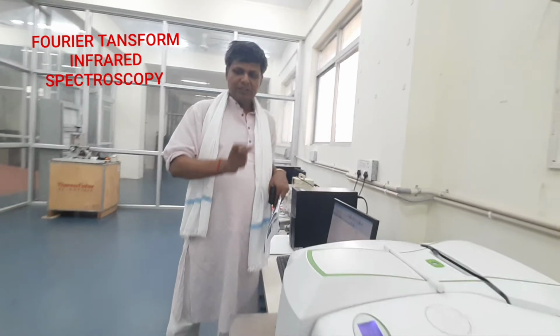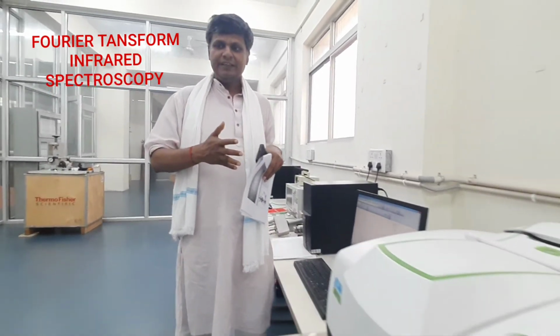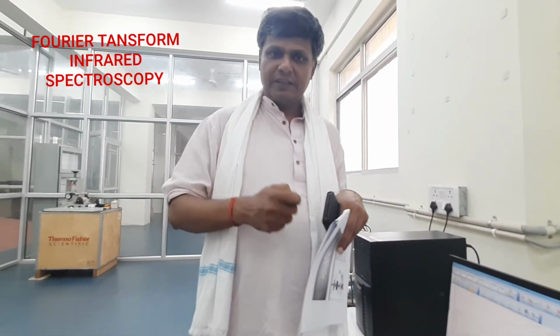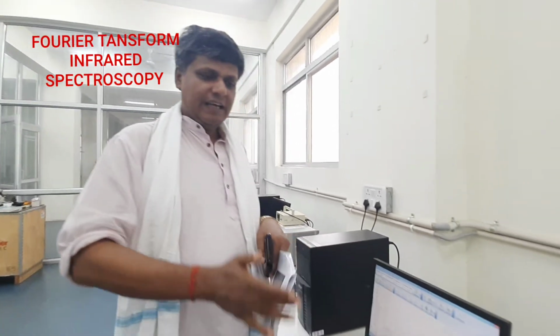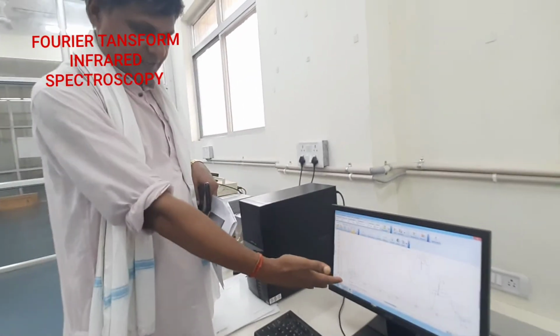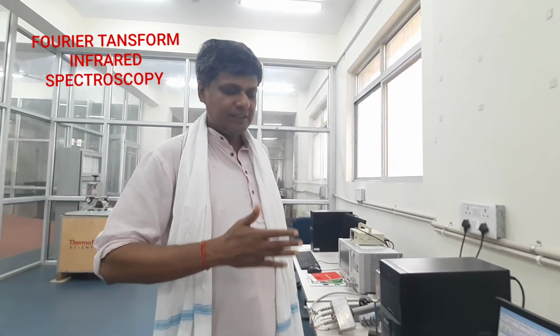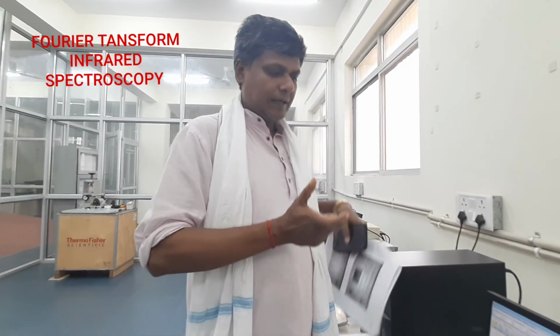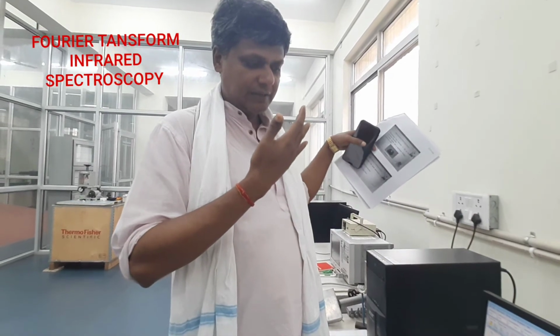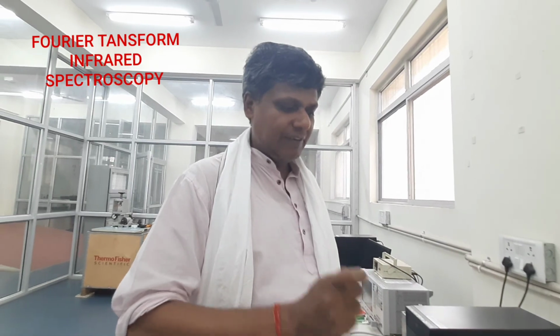In the first step, you prepare the sample, and the sample is mixed with KBr, as we have seen, and then you form a pellet using hydraulic pressure, and finally you put the sample in this equipment, and infrared radiation is allowed to be incident on this material, and we get a spectrum of this material. This spectrum defines the vibrational frequency of the atoms of the molecules, and this frequency can be compared with the standard data file, and on the basis of this data we can say which types of functional groups are present in the material, vibrating at a particular frequency.